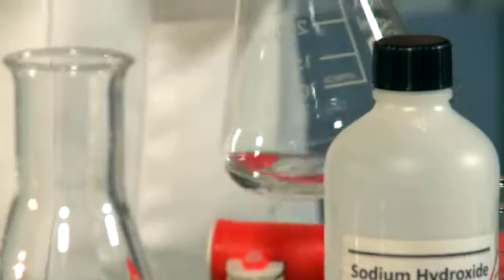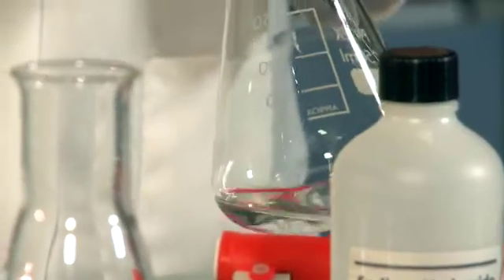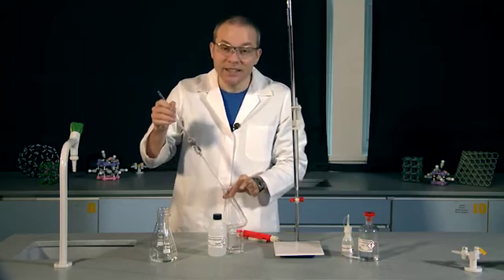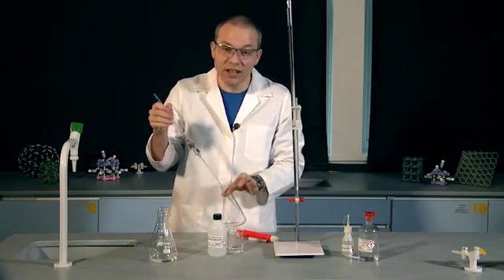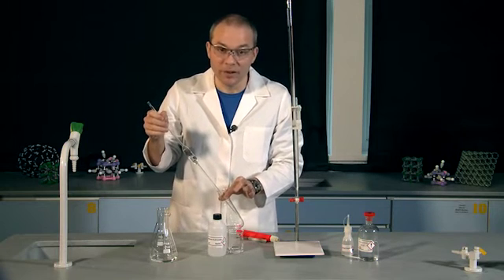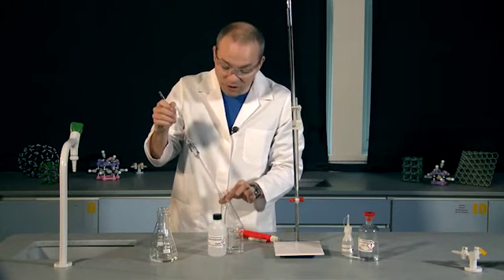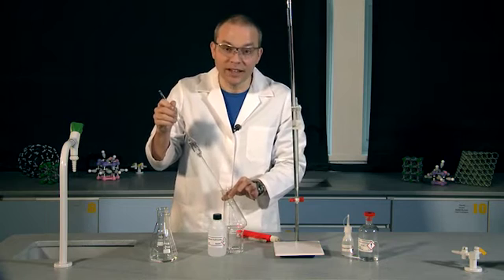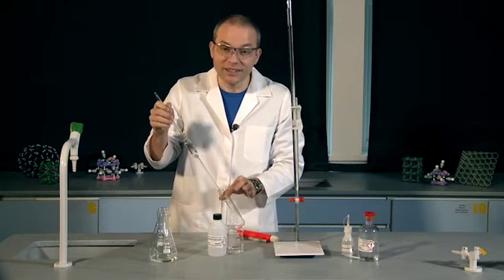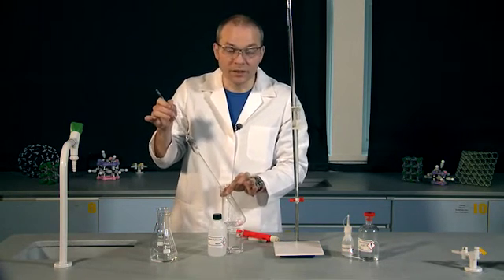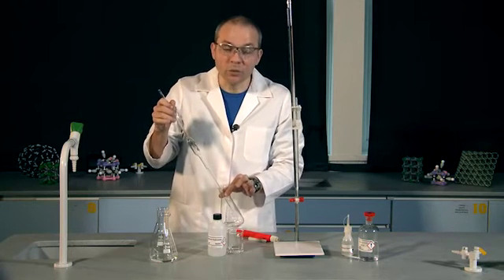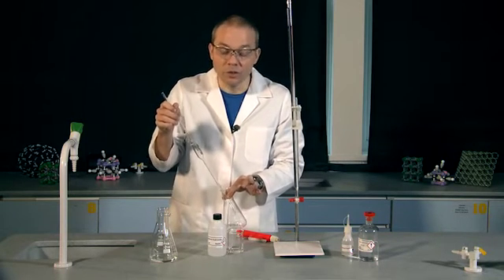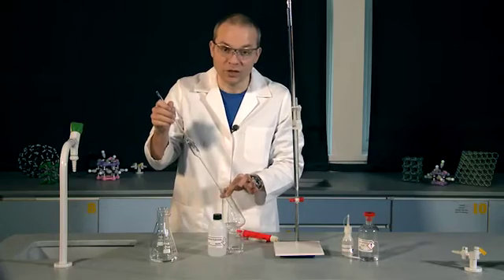Before I start the titration, I'm going to have to add an indicator to this solution. An indicator is just a substance that changes colour when the titration is over. The indicator I'm going to use is phenolphthalein, which is bright pink in alkaline solutions like this one and will go colourless when the titration is over, when I've neutralised all of my sodium hydroxide solution.